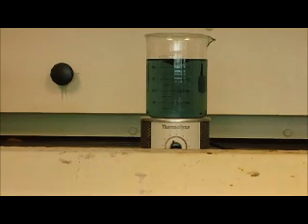Yeah. So this whole reaction is based on the concentration of bromide ions. There are 2 processes, process A and process B. Process A occurs or dominates when the bromide ion concentration rises above a certain point. And then what occurs in process A is the consumption of those bromide ions, and as enough are consumed and the concentration decreases enough, then process B will dominate.